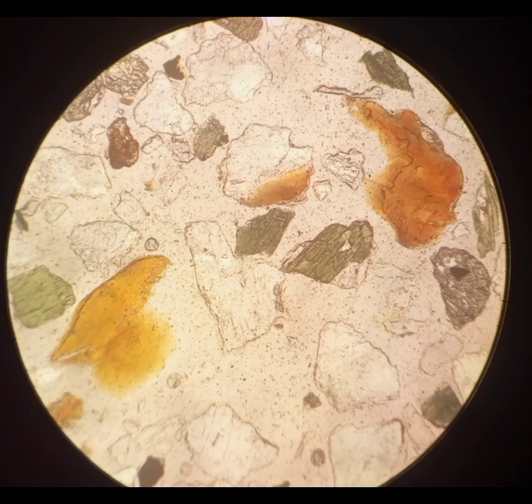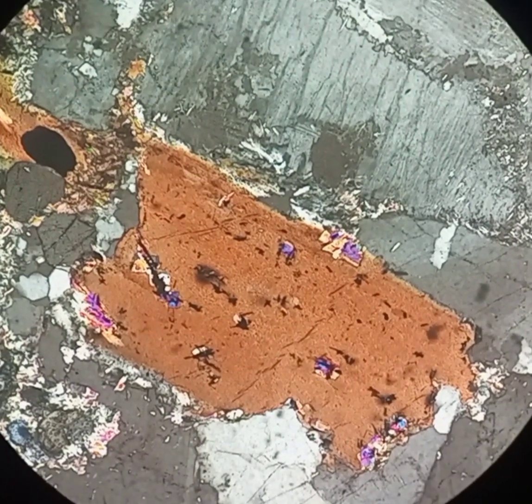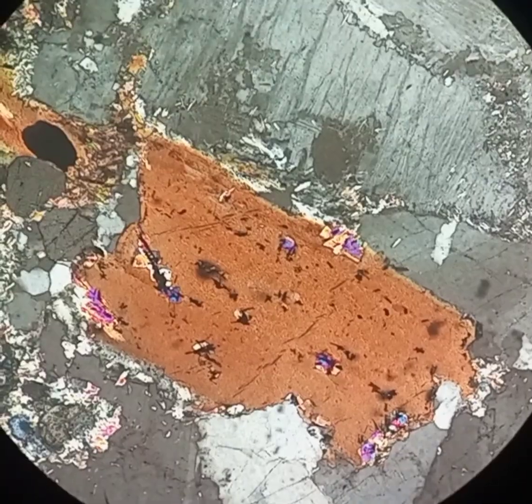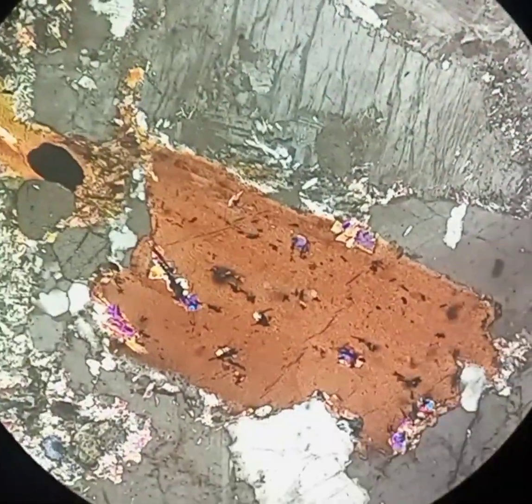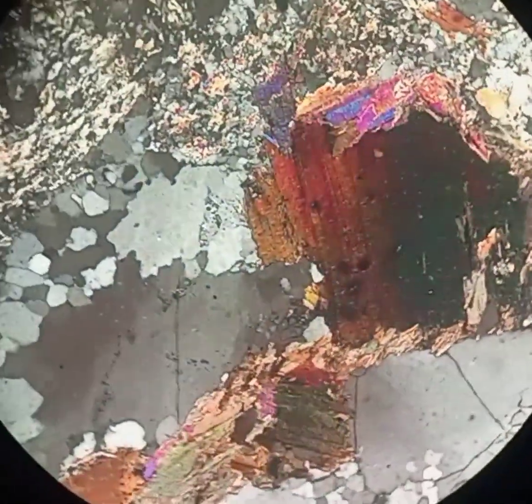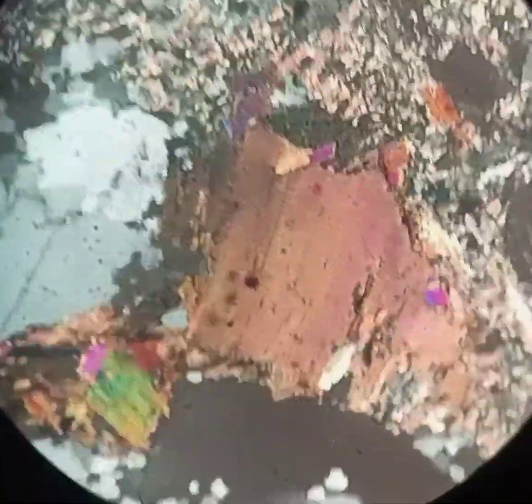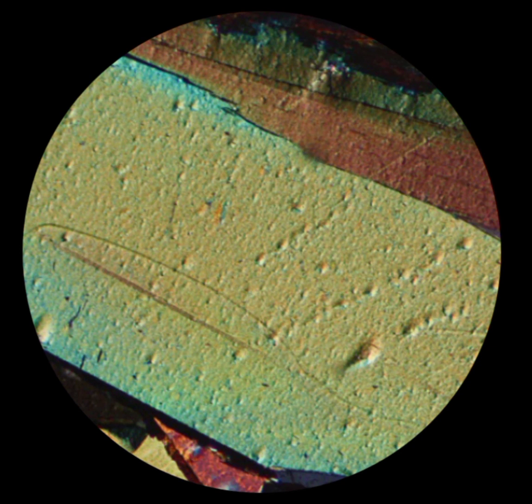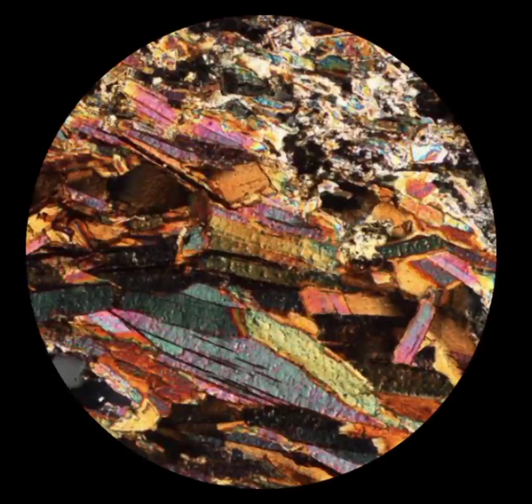Biotite belongs to the phyllosilicate mineral group. We are going to discuss the major properties of biotite under the optical microscope. In cross-polarized light, it is an anisotropic mineral that changes its color on the rotation of the stage. It shows various colors: green, brown, pink, yellow, dark brown, and brownish black on the rotation of the stage.